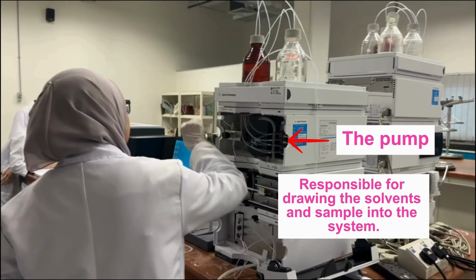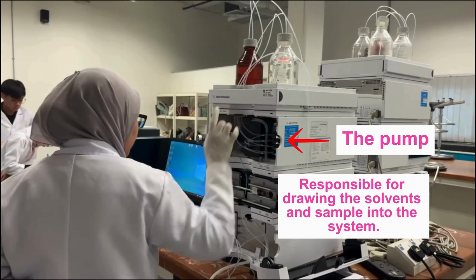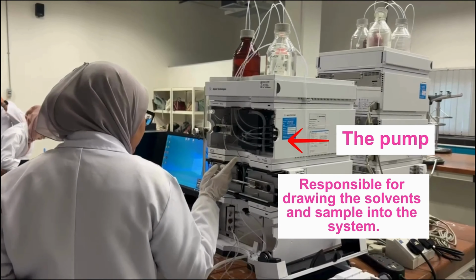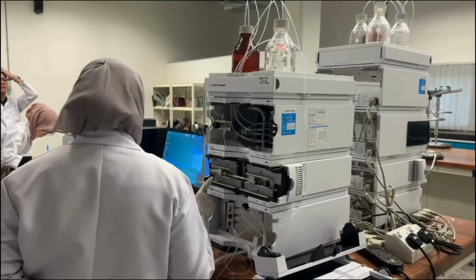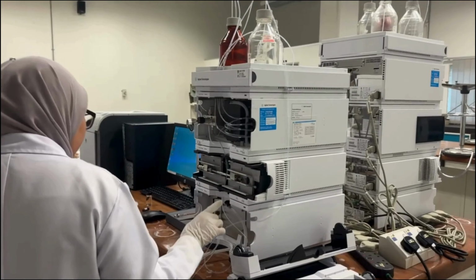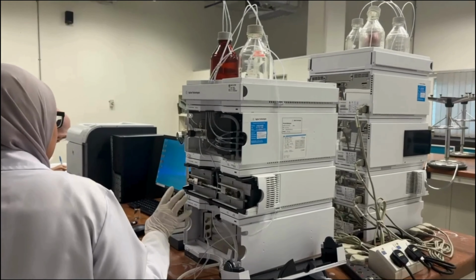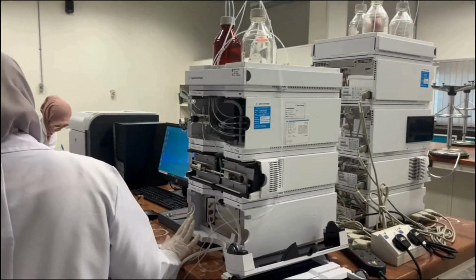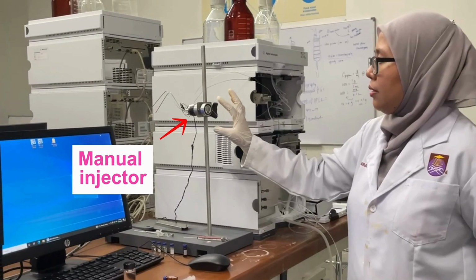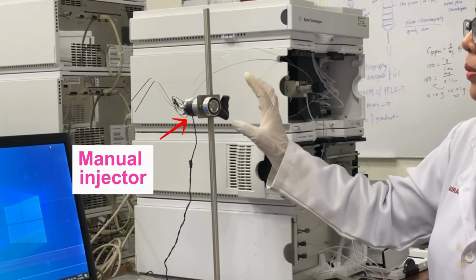So, this is the pump which is responsible for drawing the solvents and sample into the system. Once the sample and solvents are drawn in, they pass through the carbohydrate column. This column plays a crucial role in separating the compounds of interest. After passing through the column, the compounds are detected by the RID and then collected in the waste bottle. So, our system uses a manual injector.